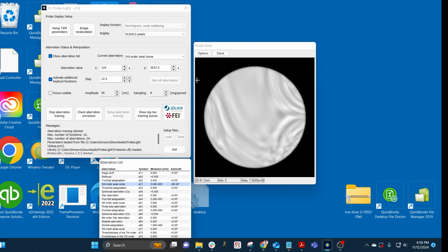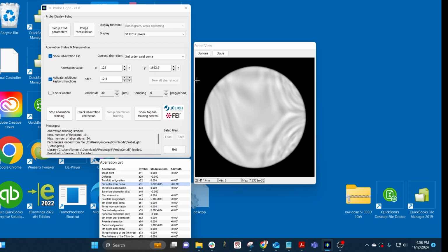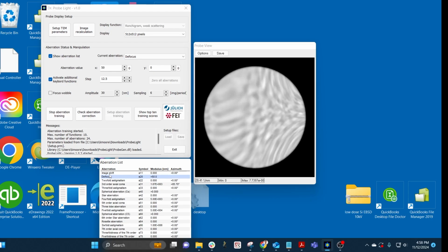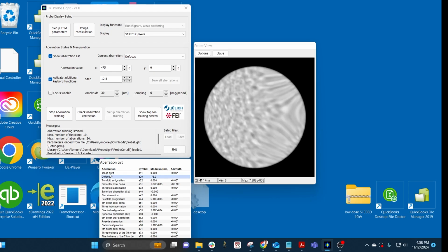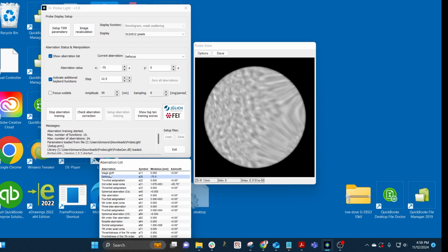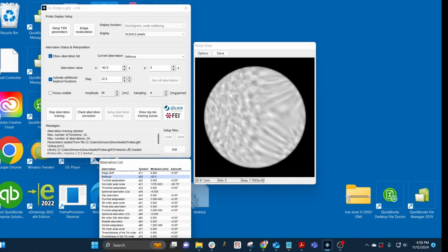So I've gone a bit too far there, it seems. And once you really get into this regime, it's very difficult to correct coma when you can't see that egg shape anymore. So I'm going to adjust the defocus again and try to get it more towards something recognizable. Now once it's close, I do find it easier to adjust the defocus so that half the image is out of focus, half of it is at focus. And then you adjust the coma to try and make that flat.